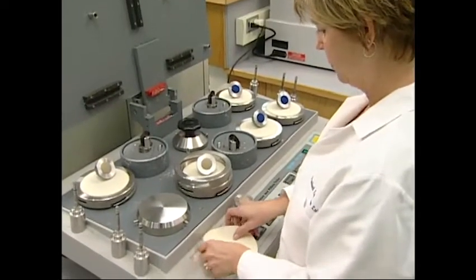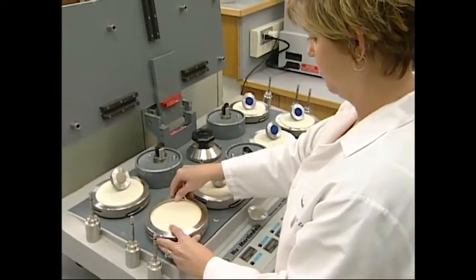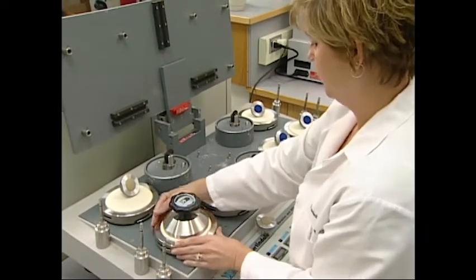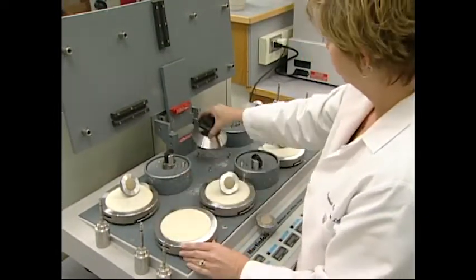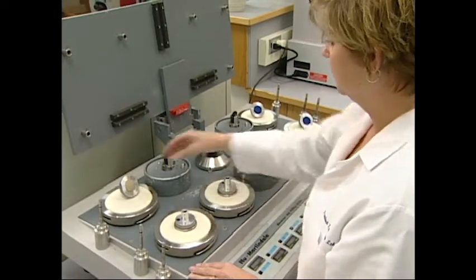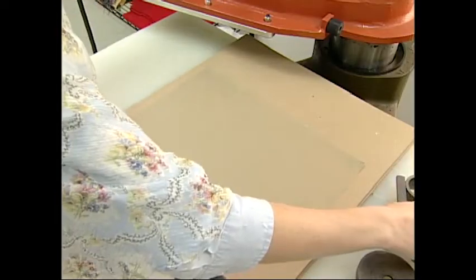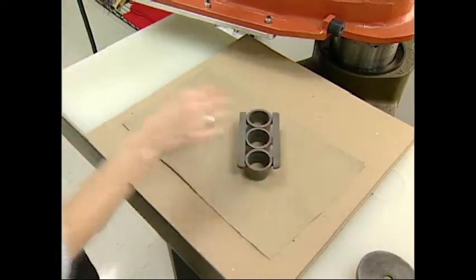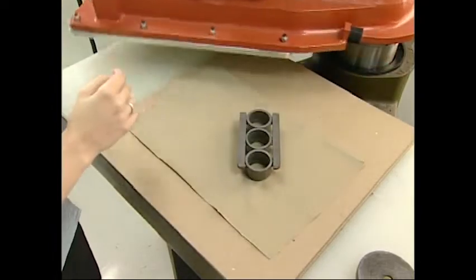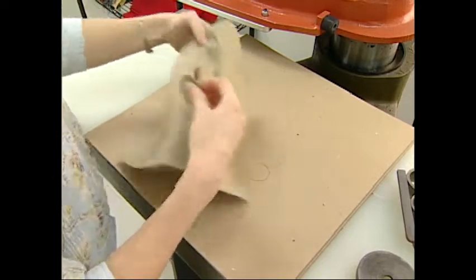The Martindale tester has mounting positions for the specimen and the abradant. The bottom mounting position uses a large round sample or abradant, and the top position holds a small round test specimen. In the normal abrasion test, the specimens are die cut to the specified size. Whether woven or knit, the die punches out the specified number of specimens for the test. Shown here is a woven twill.